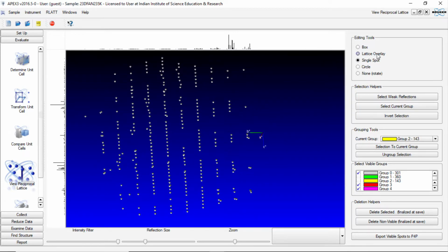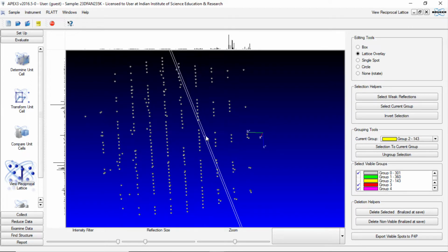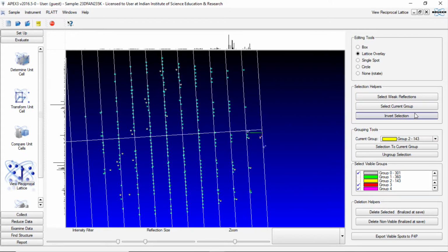We then again try to do the same operation from this to that. To reduce the number of lines, you press the minus button and then again do this adjustment from one end to another. And then start making it plus till these lines match, and then add page up so that the other sides are taken. And then again do invert selection and send the ones not selected. Send the ones which are selected to yellow and the other ones will remain as gray.